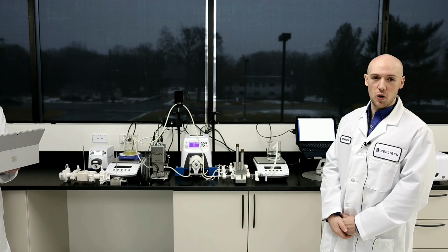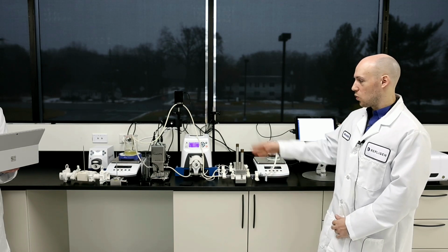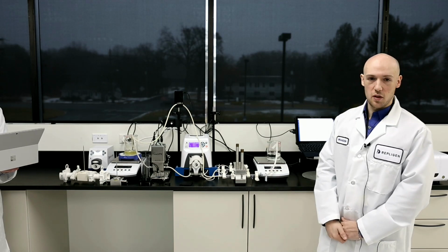But you could use both with the system. Like I said, put one on your permeate just to see if anything's escaping, and then one to actually control your process based off of concentration.